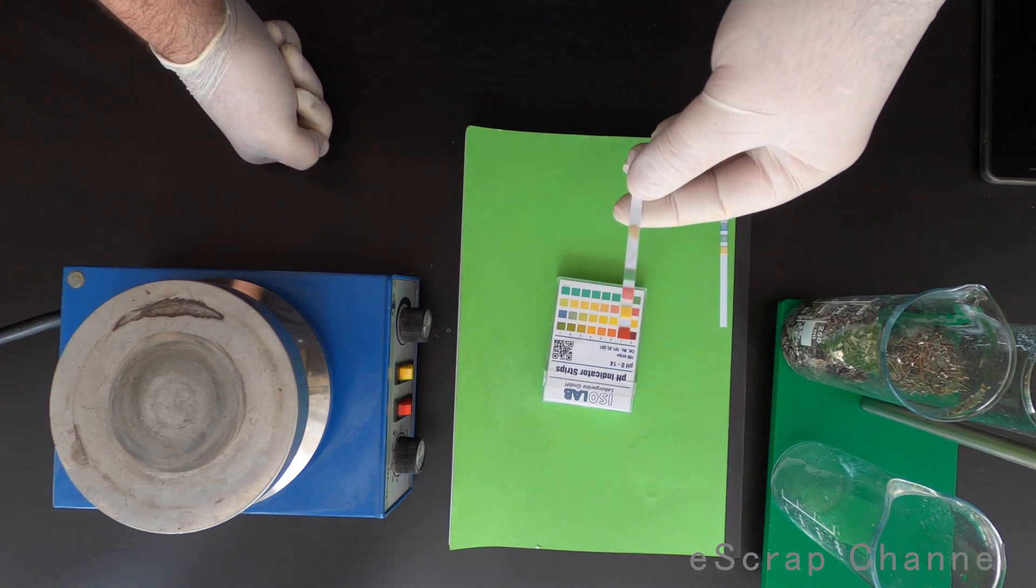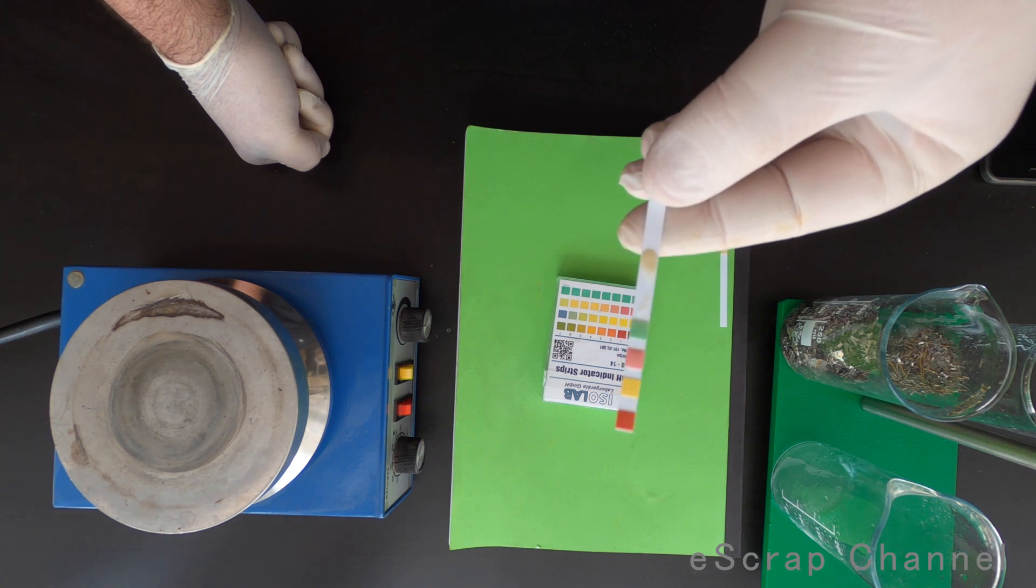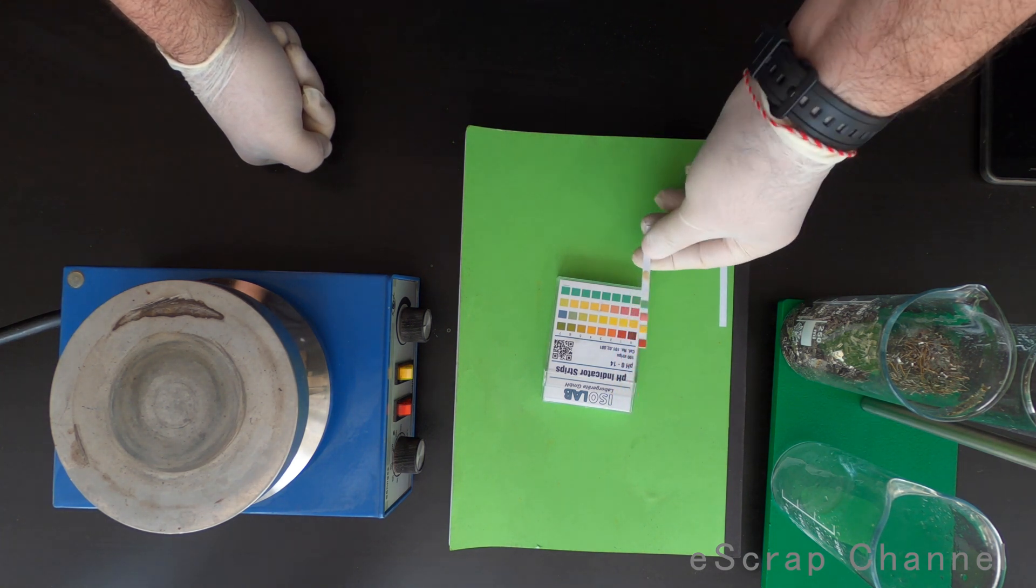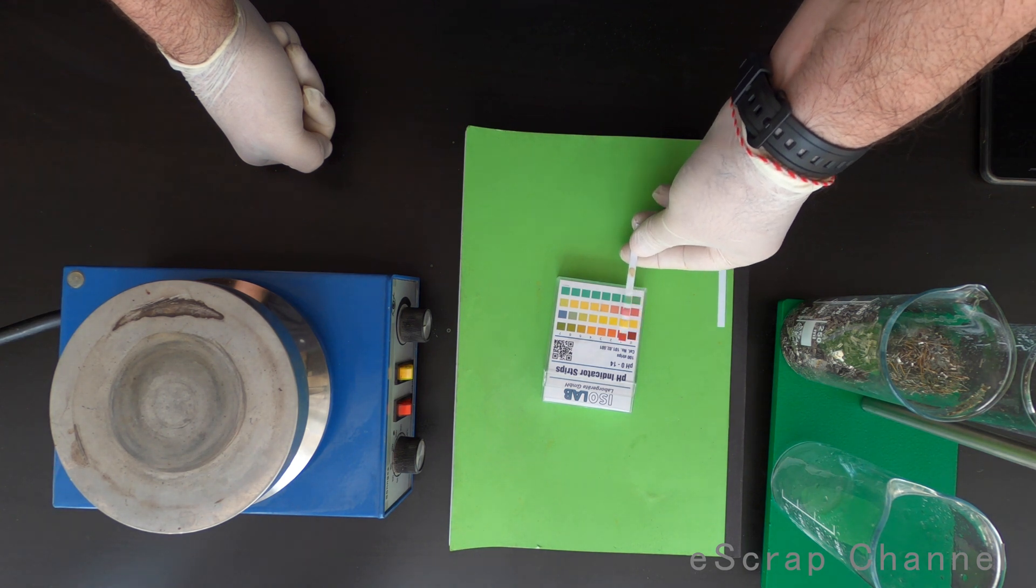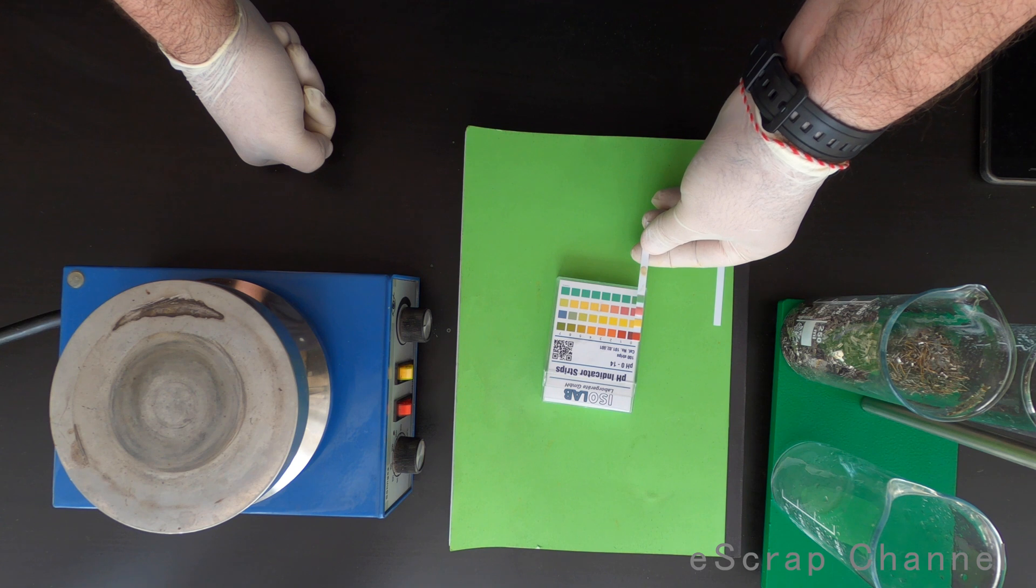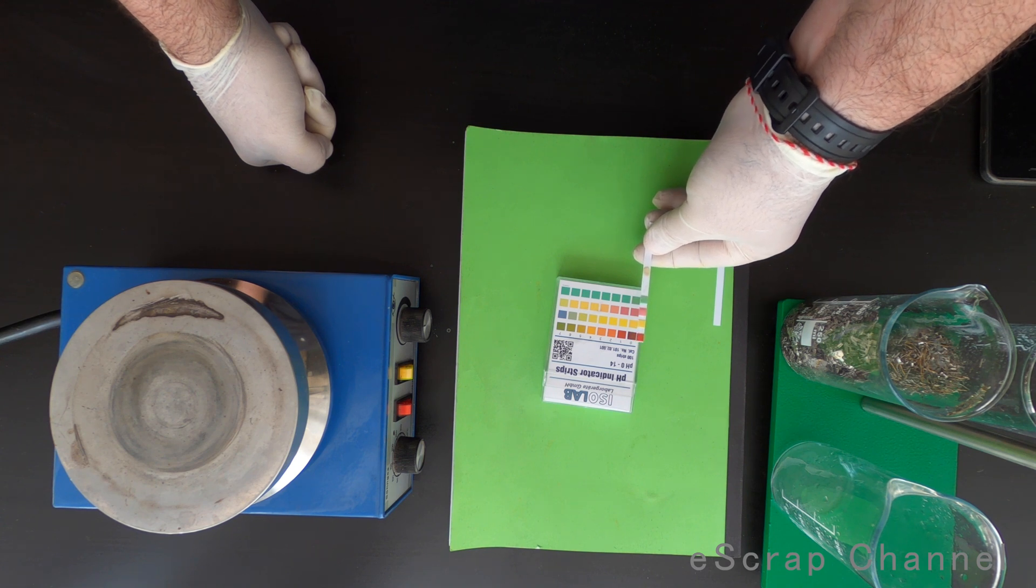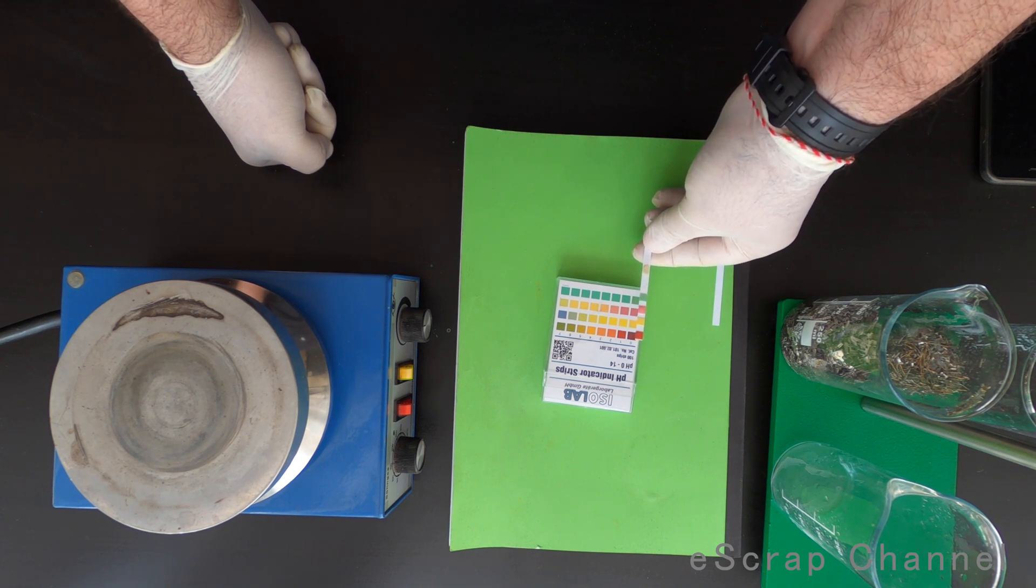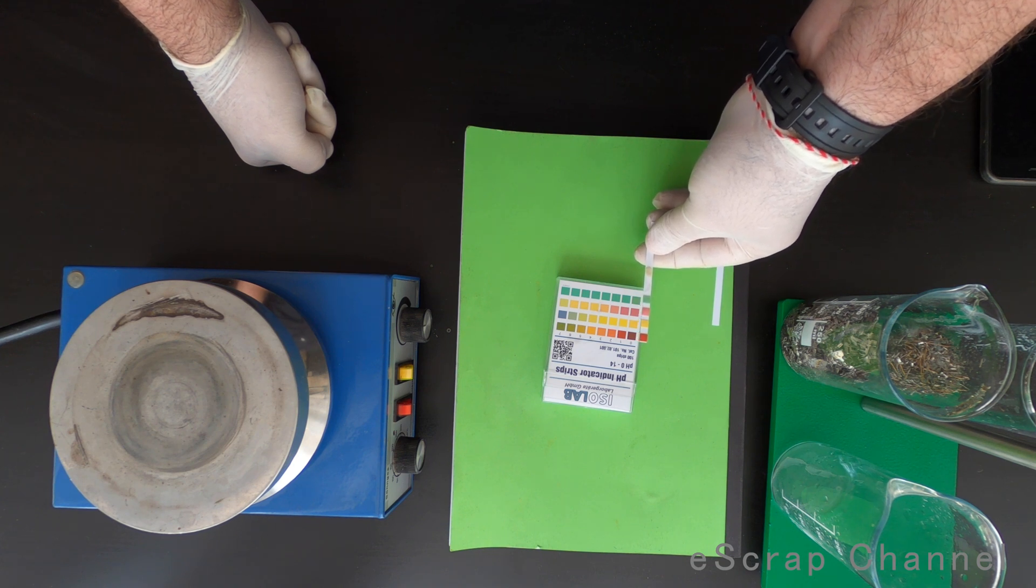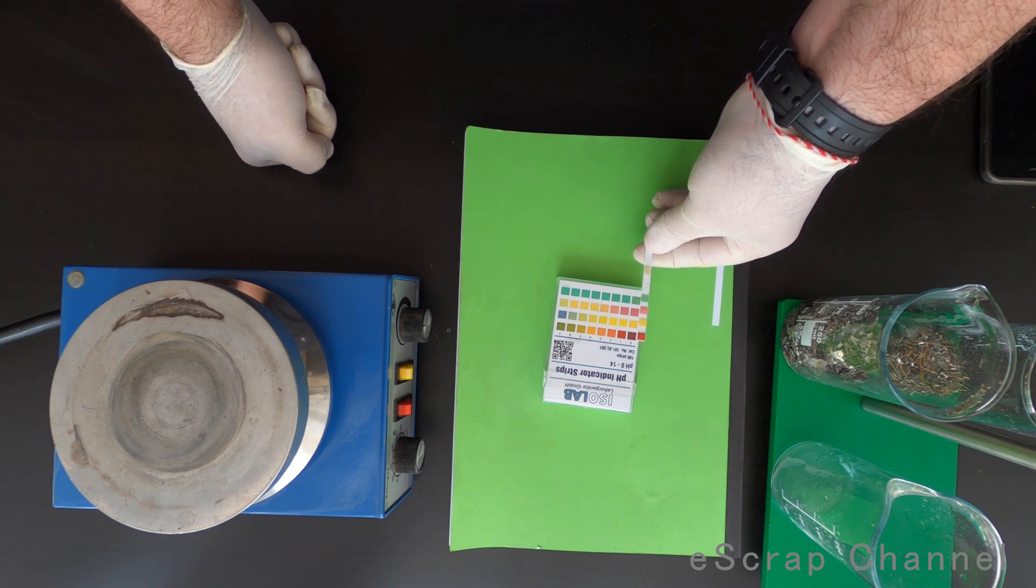I just adjusted the pH with hydrochloric acid and now solution is pH 1. I think at about 0.1, so it's extremely acidic. I dropped too low but I will add zinc, fix this, and have my gold precipitated.